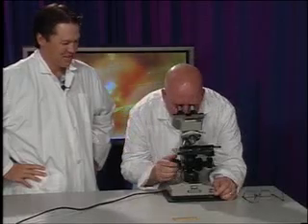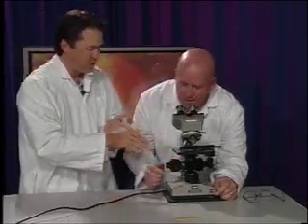What you'll want to do is get it as focused as possible with that coarse focus. That's interesting, because it's really small on there, but when I'm looking in here, it looks pretty big. How many times bigger than normal would it be? It would be 10 times 4. Excellent. 40. Right on. Okay, can I go into medium? I would maybe just play with the fine focus first of all.